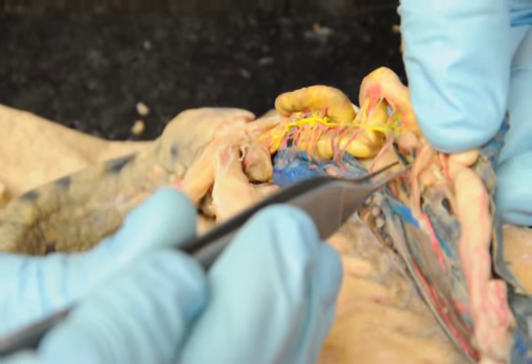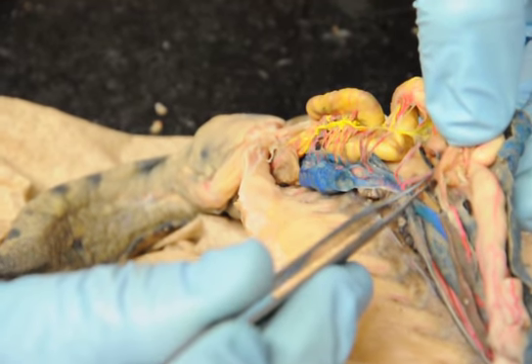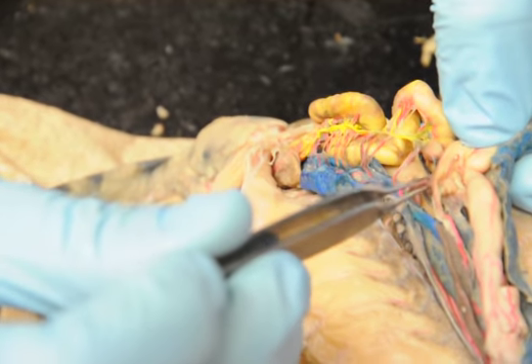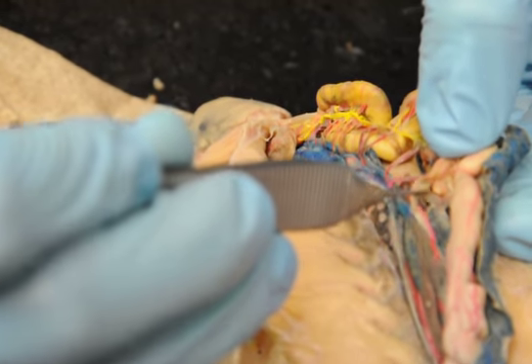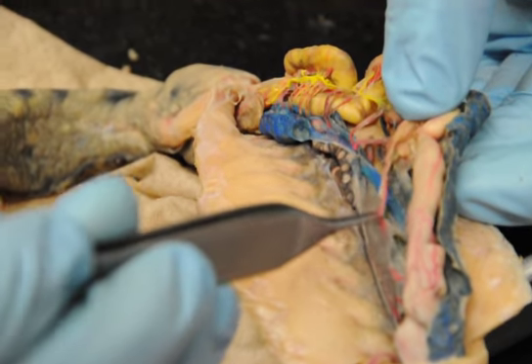Duodenal, sorry. Pancreatico-duodenal. The one that's going to go straight back, in this case, to the liver. What goes to the liver in the cat? The hepatic, yep, so that's the hepatic. And then there's one that makes a right turn over here and goes to the spleen, so which one's that? Splenic.